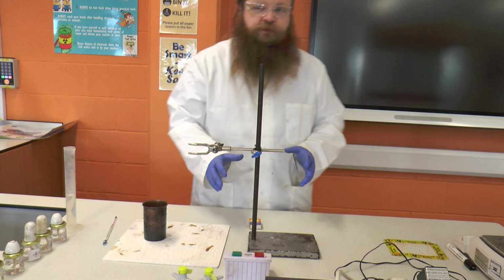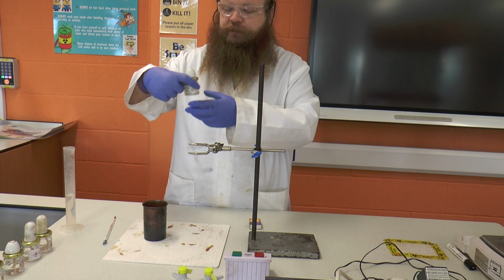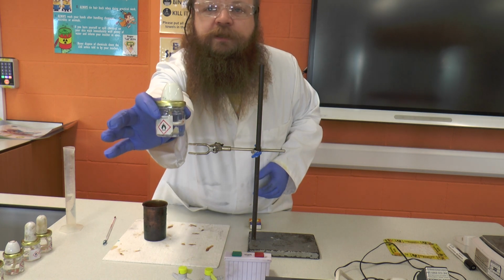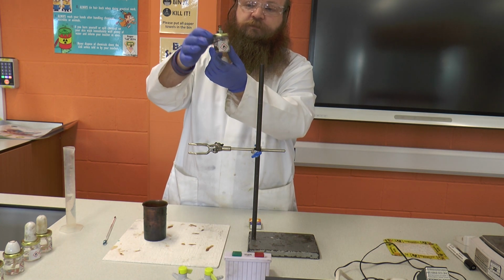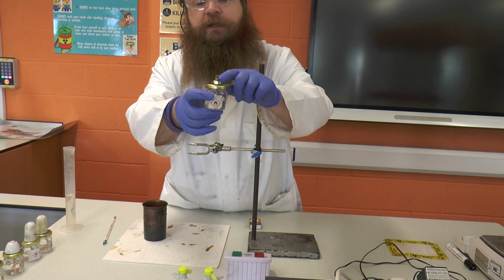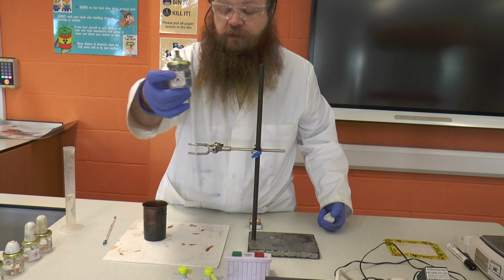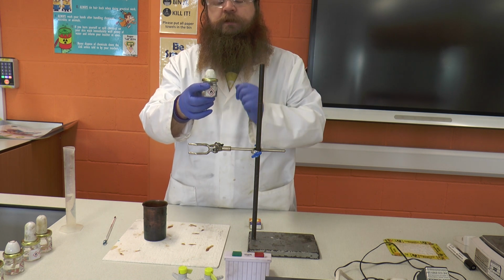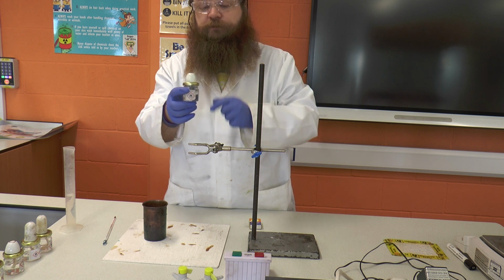To do this, we're first of all going to take our first burner. These are little spirit burners, which you may be able to see there. All they are is a little jar containing alcohol with a little wick, just like a candle. The wick carries the alcohol up and then the alcohol will burn on the wick. They have a little lid which we can put on to stop the flame and to stop the fuel evaporating when they're not in use.